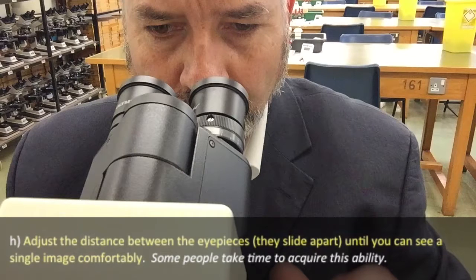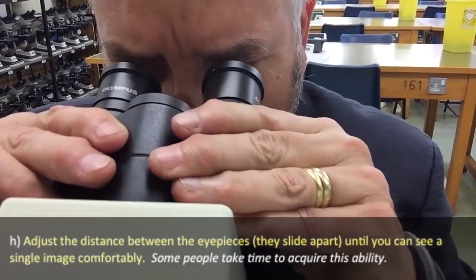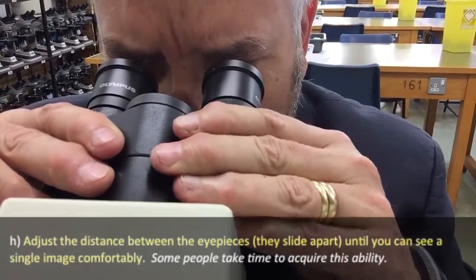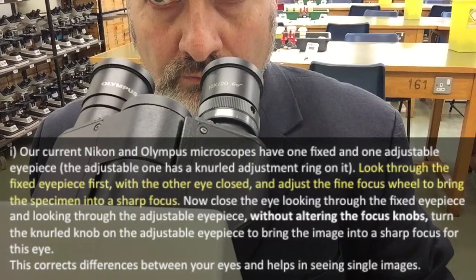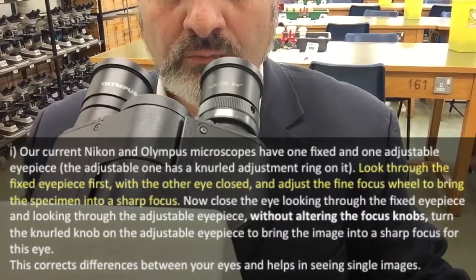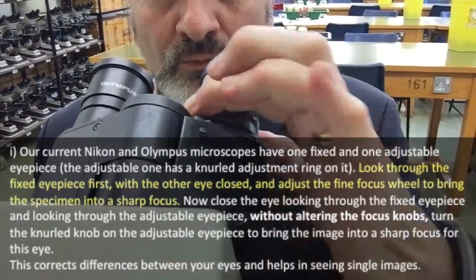Next, with both eyes open, adjust the distance between the eyepieces until you can see a single image comfortably. Some people take a while to acquire this ability. We're now going to adjust the eyepieces to suit the visual characteristics of each of your eyes. Our microscopes have one fixed and one adjustable eyepiece, the adjustable one having a knurled knob on it which allows it to move up and down when we twist it.